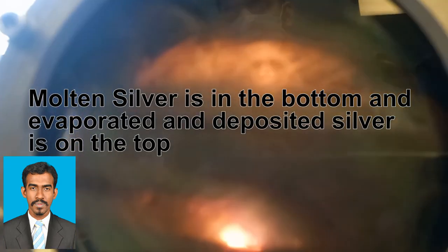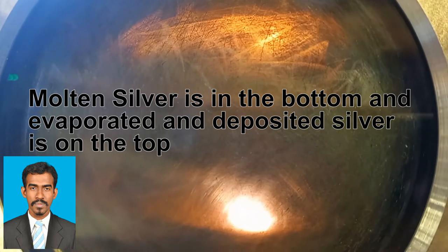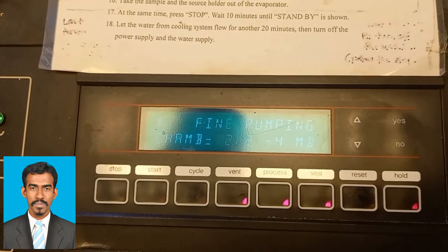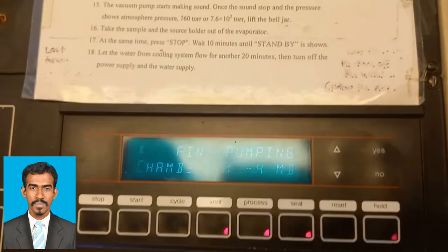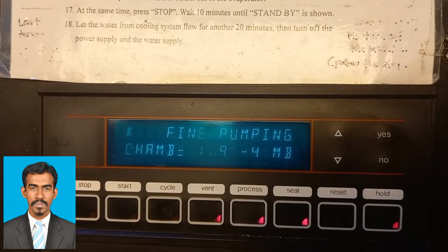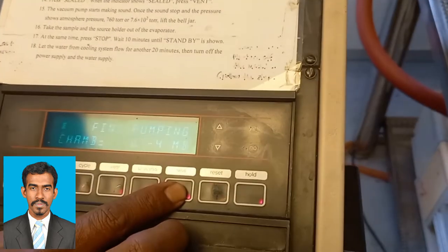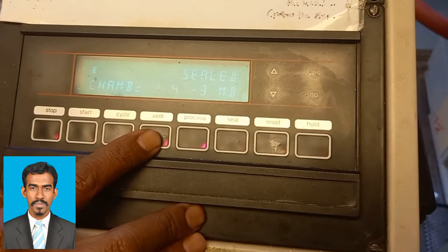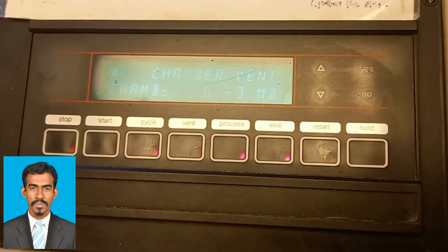You can now see on the screen how the evaporation is being done. After about 2 minutes we gradually decrease the current. At the end we move the knob from LT back to 0, and the display shows fine pumping.